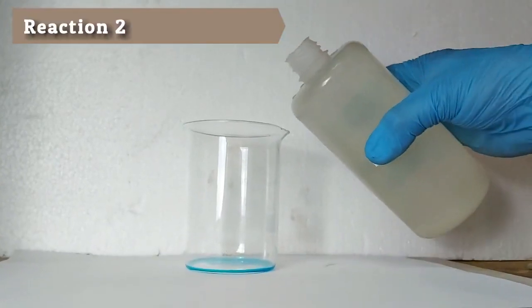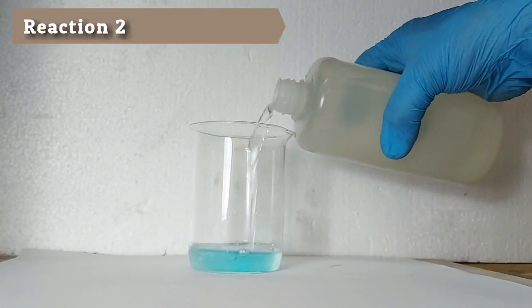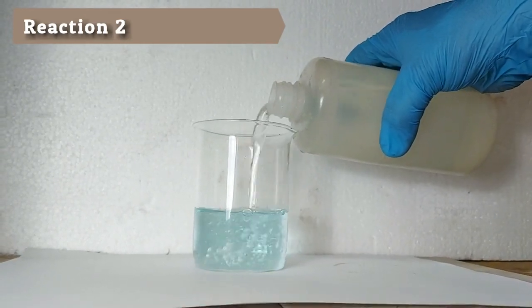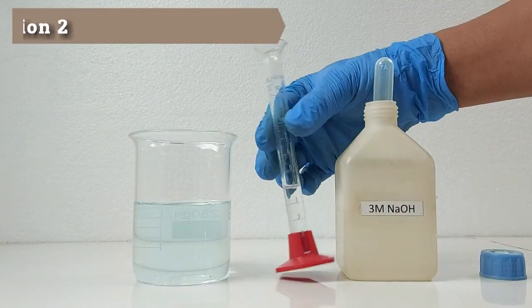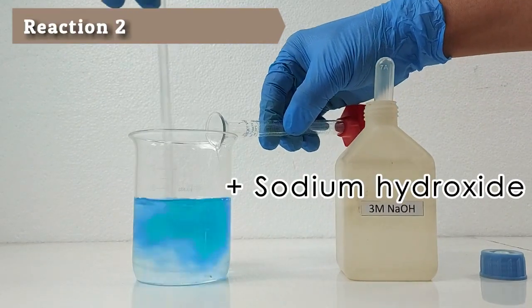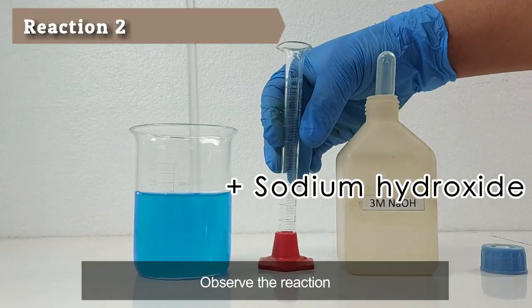After the copper in reaction 1 is dissolved completely, add distilled water until the beaker is about half full. While stirring the solution with a glass rod, add 4 ml of 3 molarity sodium hydroxide. Record your observations.